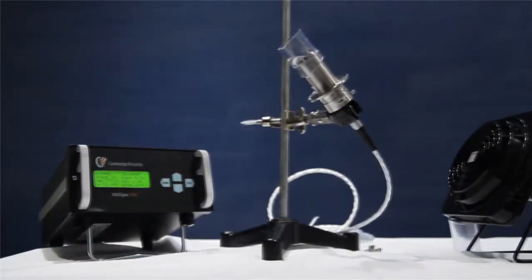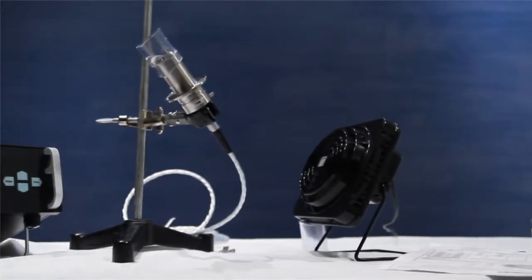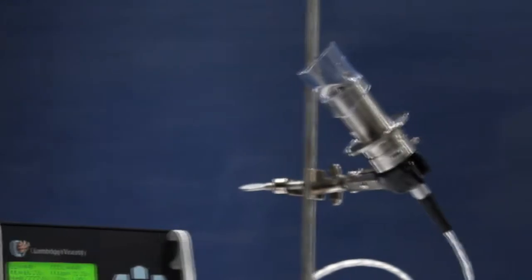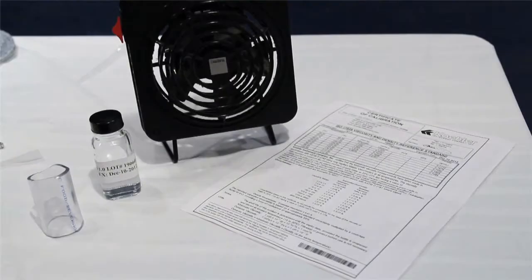Verifying the accuracy of the system can be accomplished using the following procedures. In order to provide the maximum accuracy, it is important to place the sensor in the same position as when it was calibrated. To test a viscometer sensor, you are going to need the following supplies.